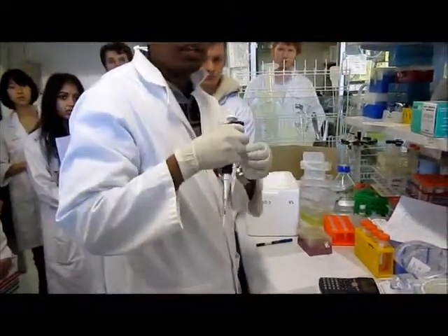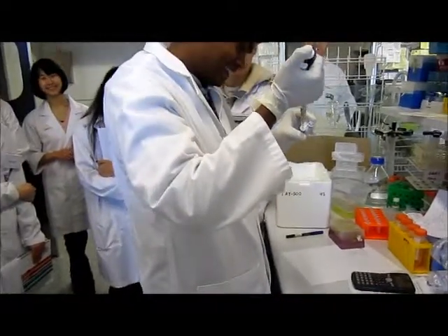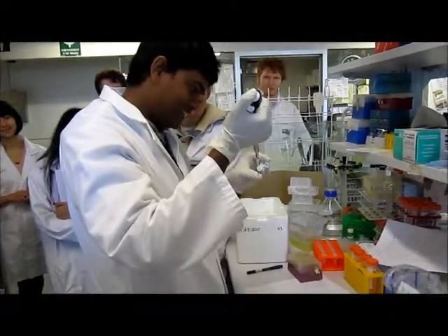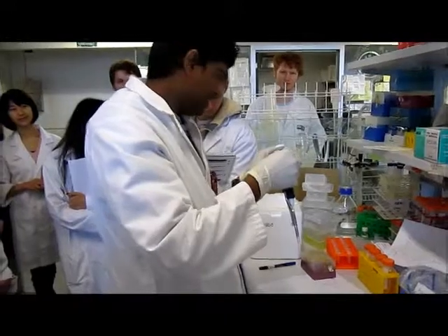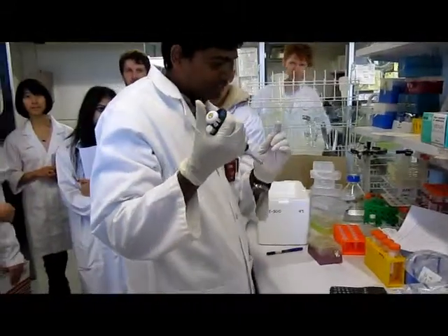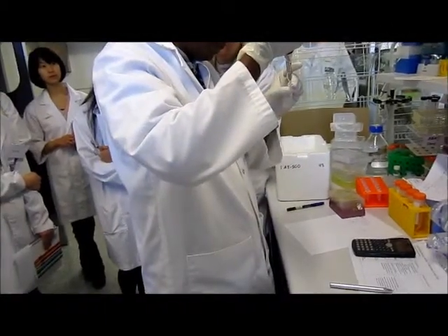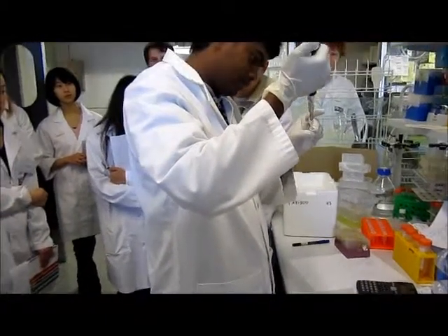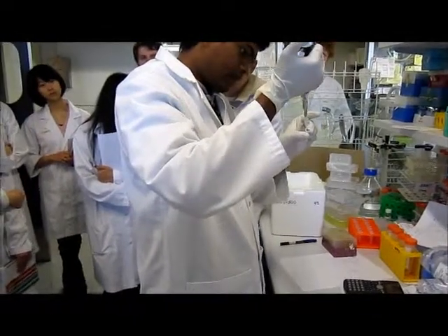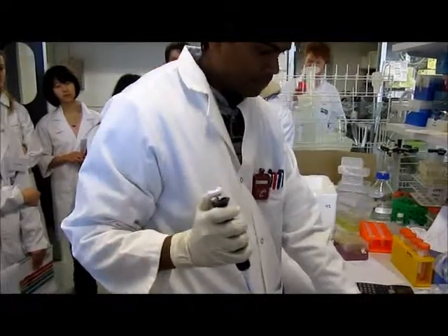I have just enough. That's good. I was scared, seeing that. Oh my god. We'll have to buy more of that, obviously. Okay, that enzyme.